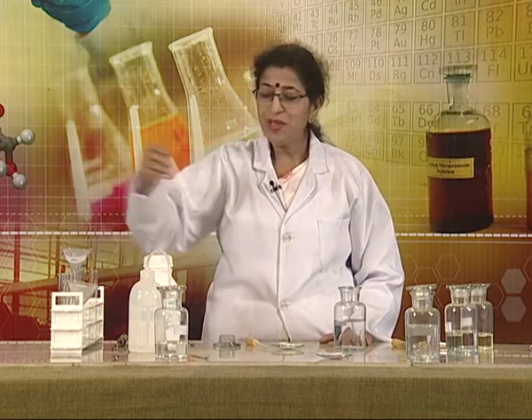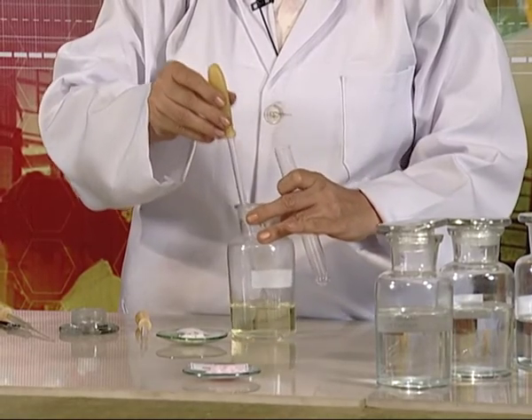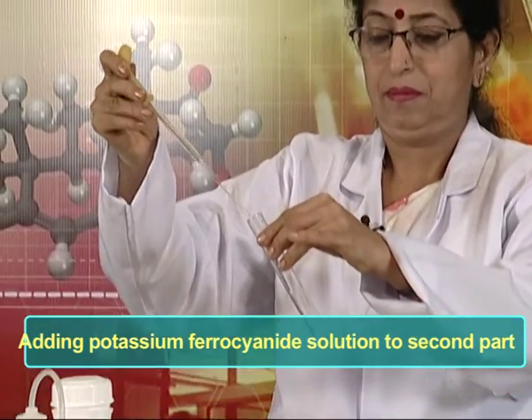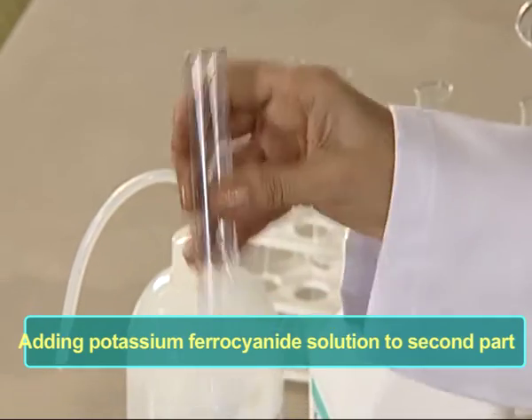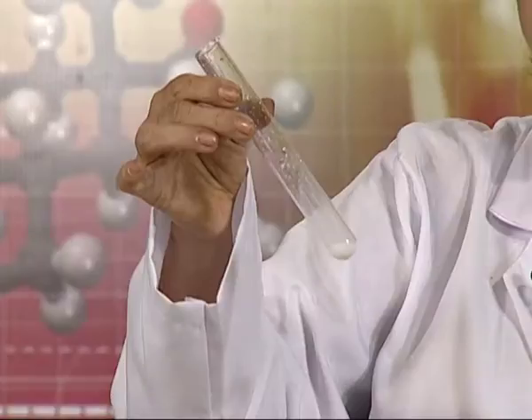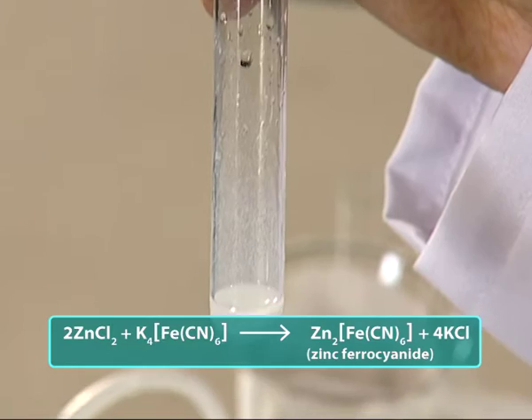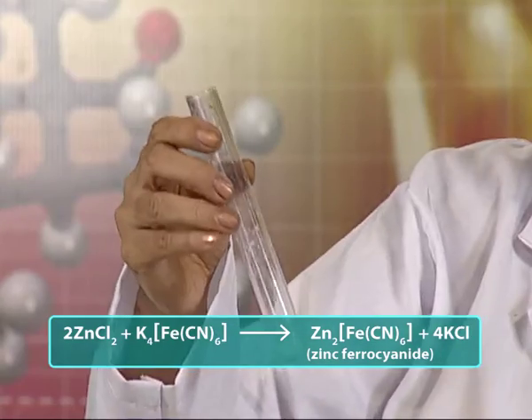Now we are doing the test with the second part. For this, we add the reagent potassium ferrocyanide solution. A slightly bluish-white precipitate is obtained, whose chemical composition is zinc ferrocyanide. These two tests confirm the presence of zinc ions in the given salt.